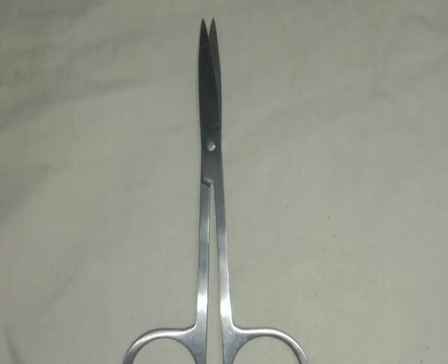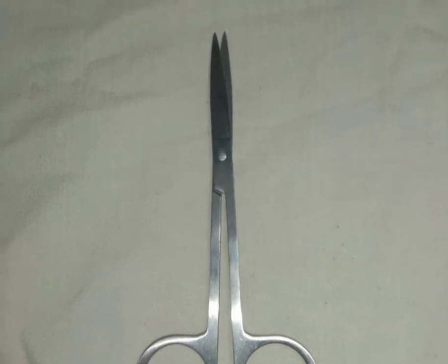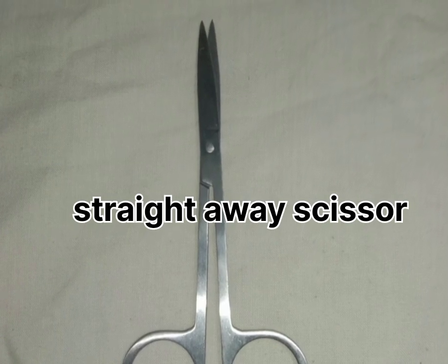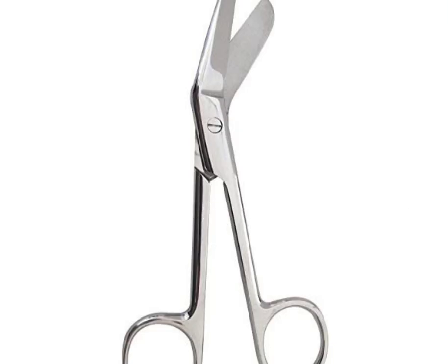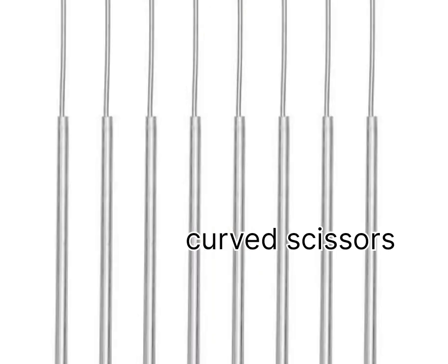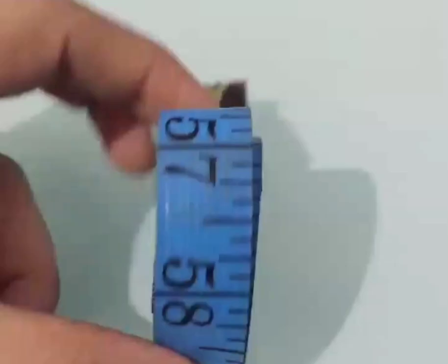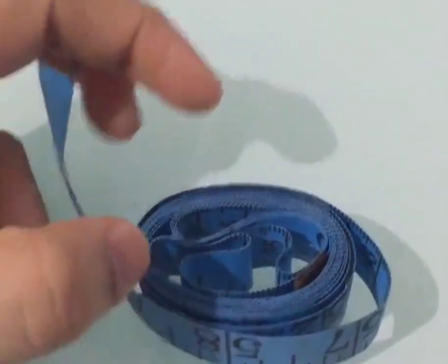Basically, there are two types of scissors. One is straight scissors, which is used to cut tissues or skin of the superficial surface. And the other one is slightly curved, which is used to cut internal organs like the uterus and other organs. Also, we can use needles for clearing the part during the dissection. And also a measuring tape is used to measure organs, for example the small intestine.